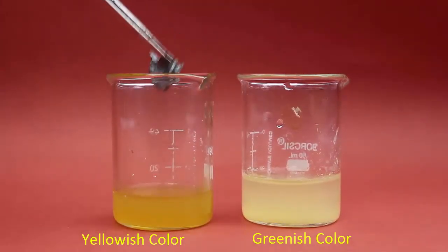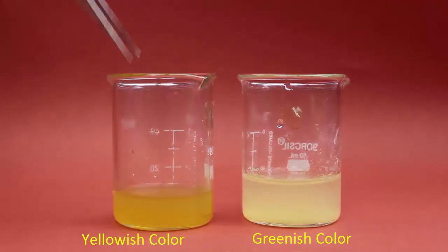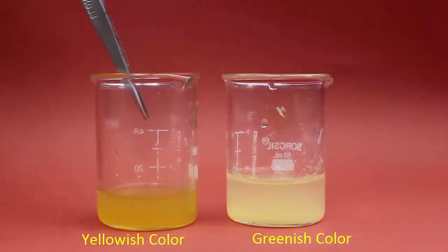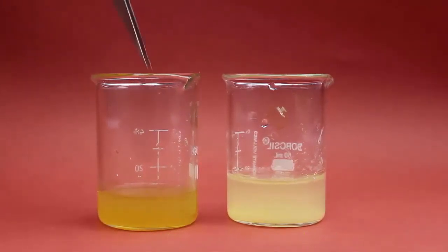In the left-hand beaker, zinc sulfate solution will be prepared and iron will be deposited at the bottom of the beaker.